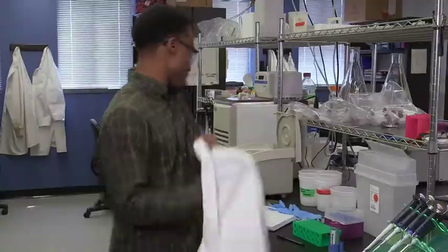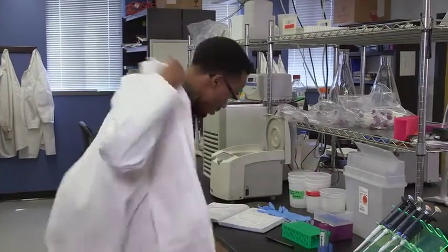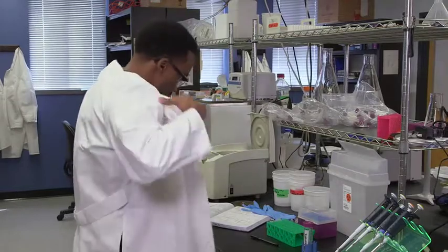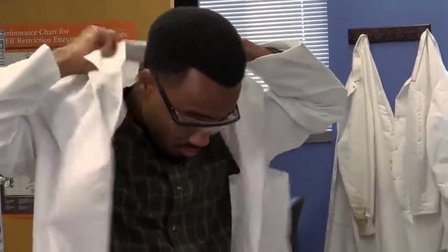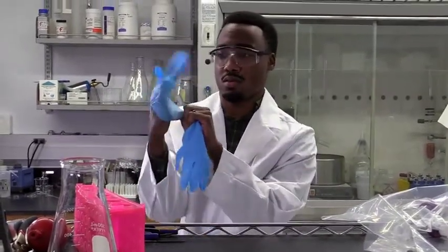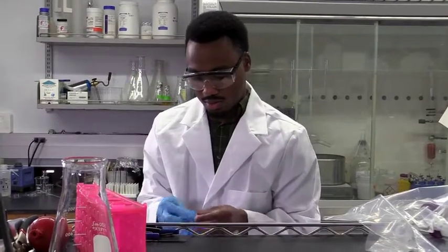Rachel, what are the special personal protective equipment considerations with each of these levels? So for any of our lab work, we ask that any personnel wear lab coat and gloves. At biosafety level 1, you would follow what's called standard microbiological practices, which would include things like washing your hands before and after commencing work. Okay. Also, no eating or drinking in lab and basic things like that.